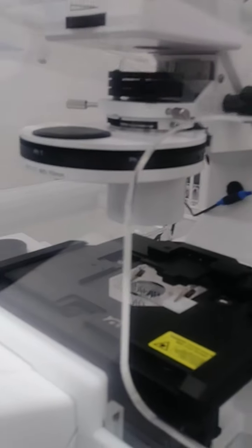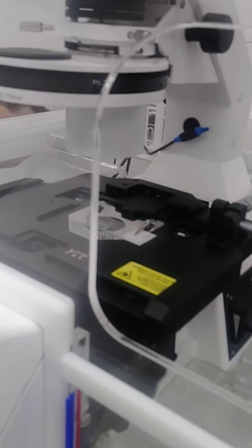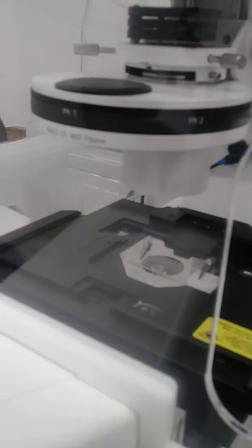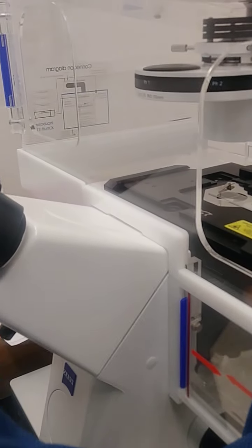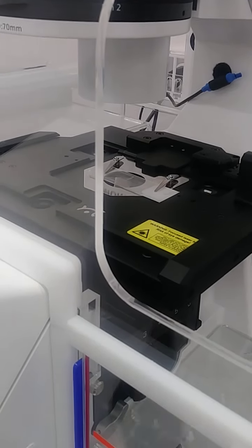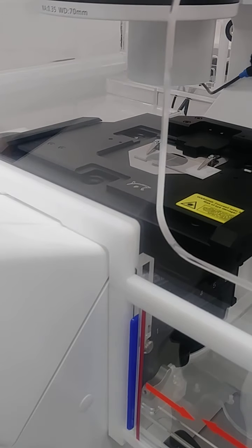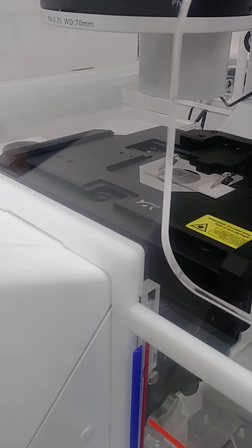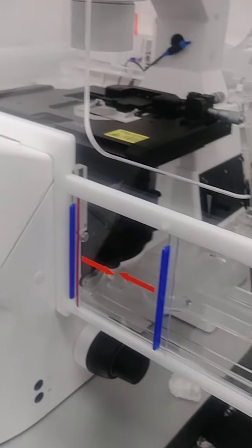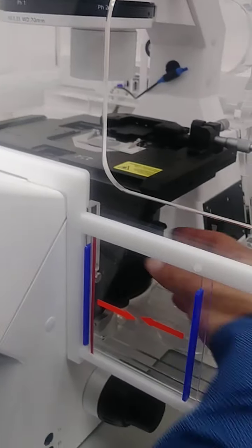So then these things here change the phase contrast? Yeah, so when you change the objective, each objective has a different phase number, so you match them. So the 20X is phase. Right, so the one that's in there now. The 40 is phase one. The 20 is phase one. Let me rotate that. And then that guy is, I'm guessing, phase one. Nope. A plan is not phase at all. So yeah, so the phase one is where you want to leave your condenser. Always. Because you're two objectives that have phase.